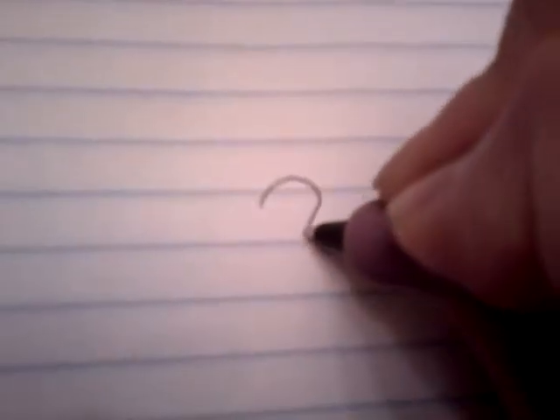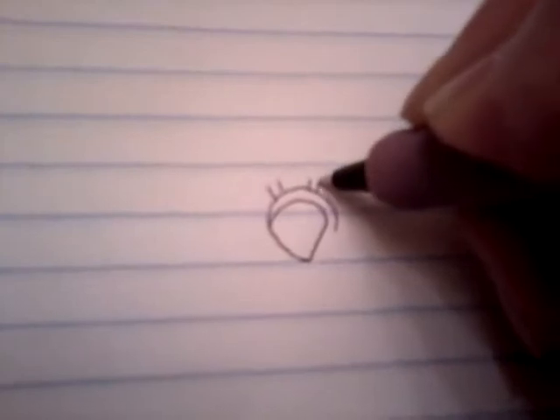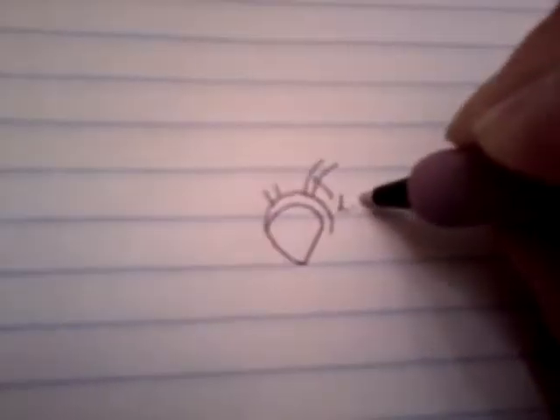We're going to now look at the cat artery, a little road map. This is the heart, and this is the aortic arch that curves towards the back. And this is a ventral view of the cat. And we have a couple of branches, like so. This branch here is the left subclavian artery, and this splits into 3 parts.